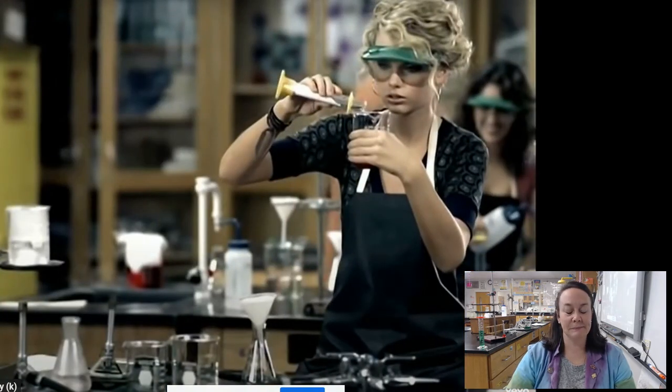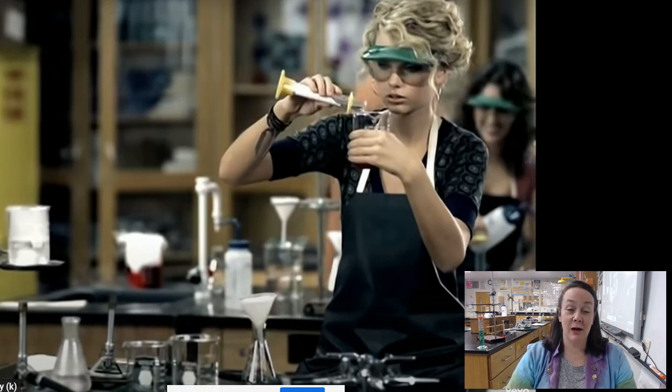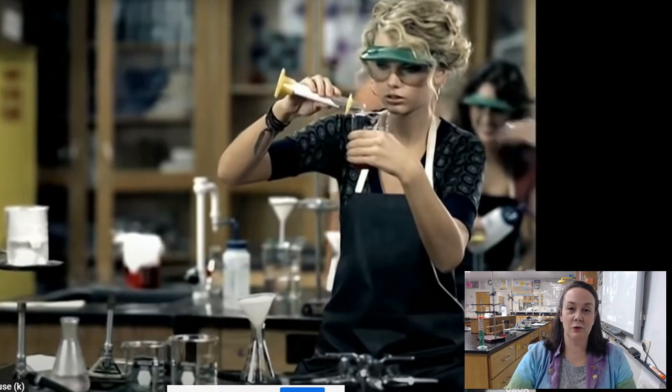No, that's definitely a solid in there. So we're going to mix our solid and our ominously red color chemical liquid in a beaker here. It's already pretty full. That's okay. Let's see. Let's see how this goes for her.